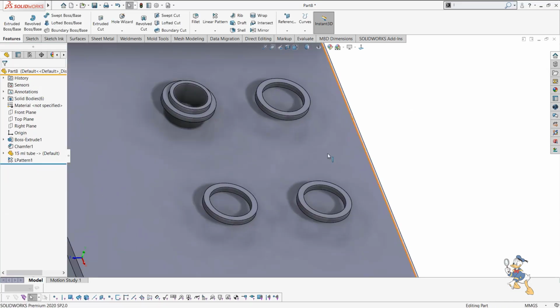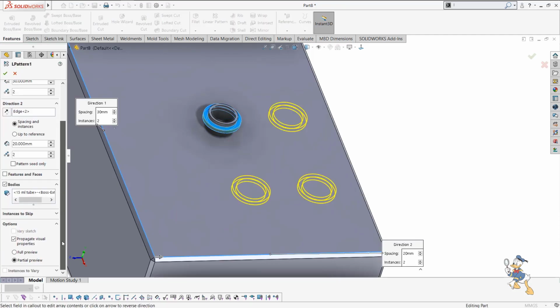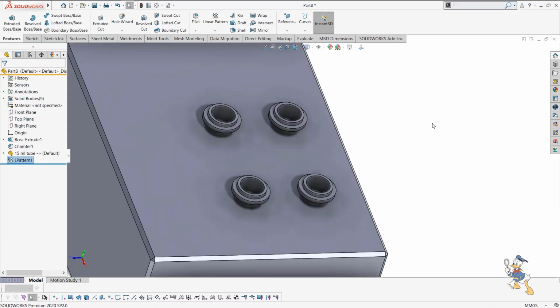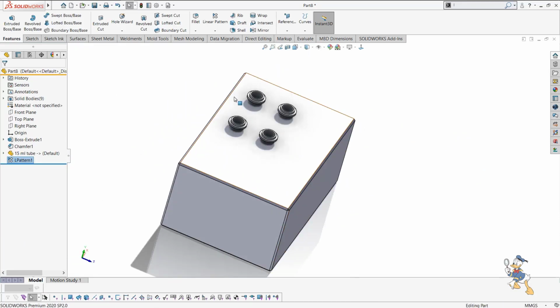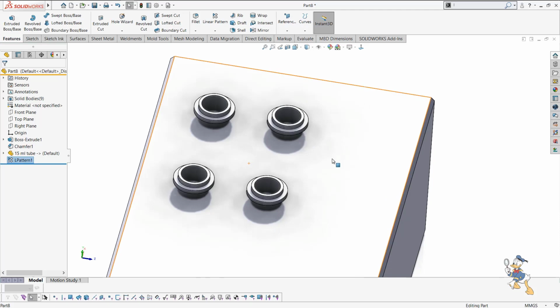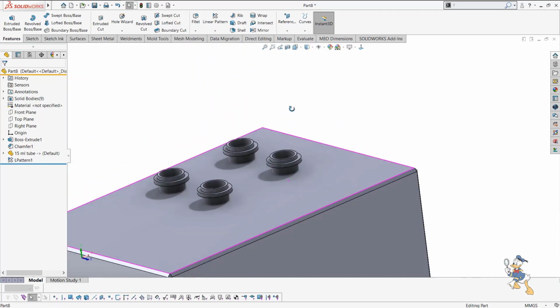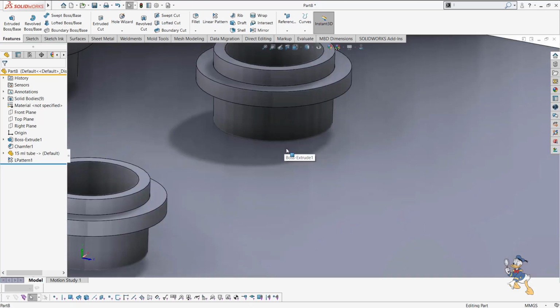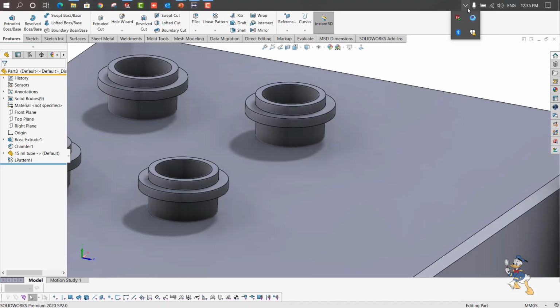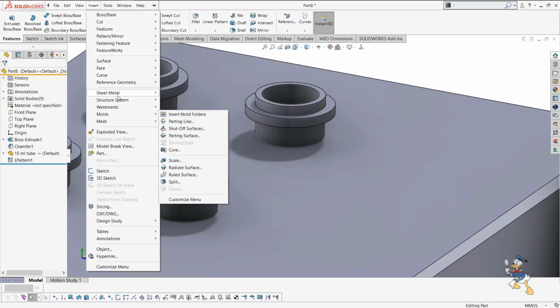So suppose we have generated the pattern, and we have selected the body as well. Now we have generated some 4 tube pattern in the block, and I just need a 4 pattern here itself. Suppose I just need to remove the area covered by the tube. There is a feature known as indent, which we can use.